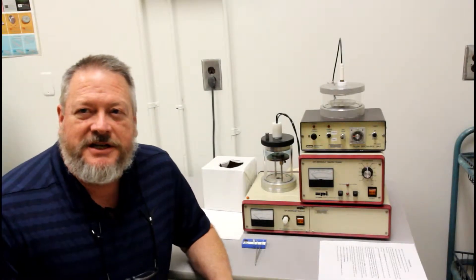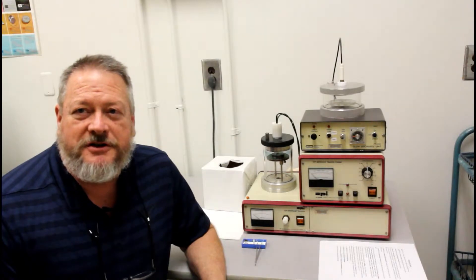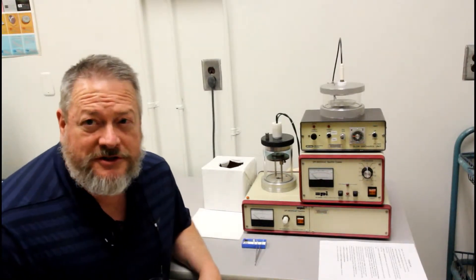Today we're going to talk about the SPI sputter coater. This is an older sputter coater. We also have a newer Leica sputter coater. Today's tutorial is going to talk about how to load and coat your sample.